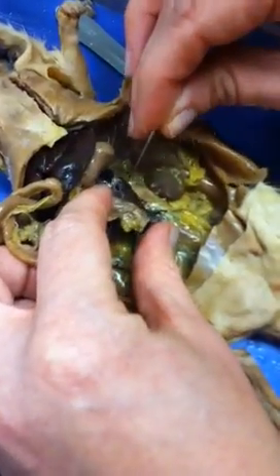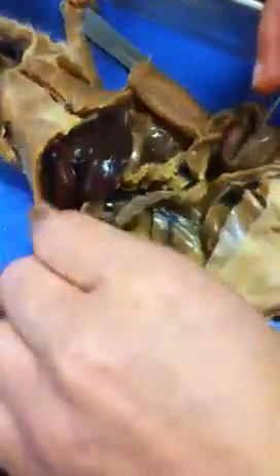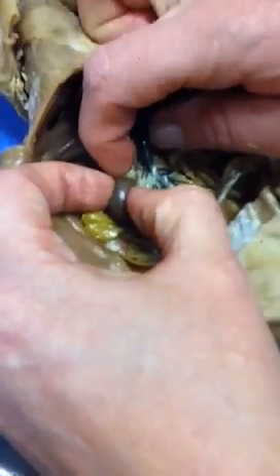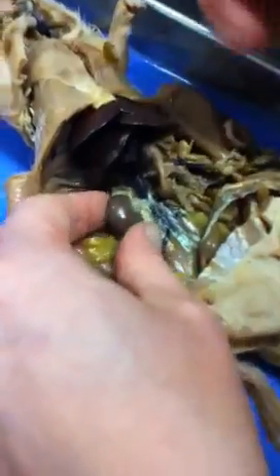This is part of your spleen. This is your pancreas. This is part of your kidney. Put it over here where you can actually see it. Here's your kidney. On top of your kidney, you have an adrenal gland. Where is it? There it is. Adrenal gland is right there. No, just can you pause your phone? Here's your adrenal gland. Okay.